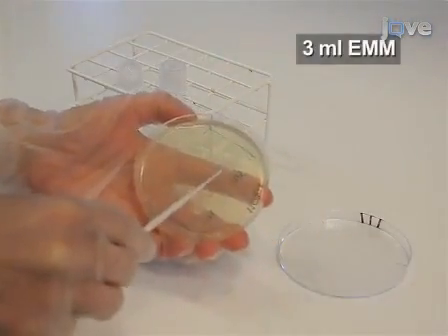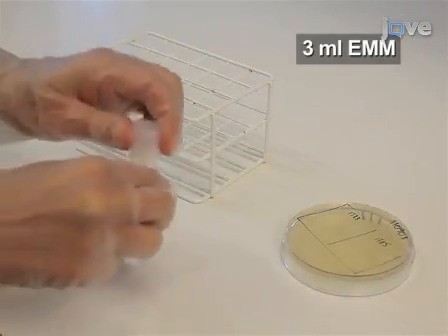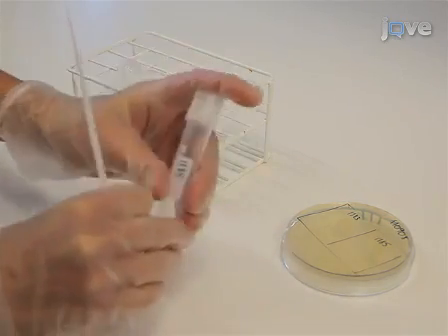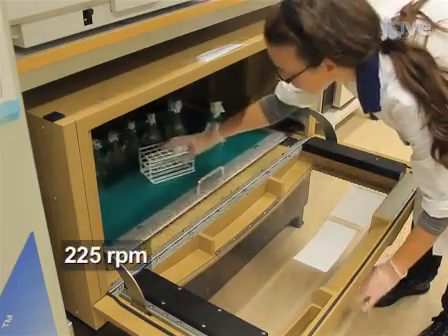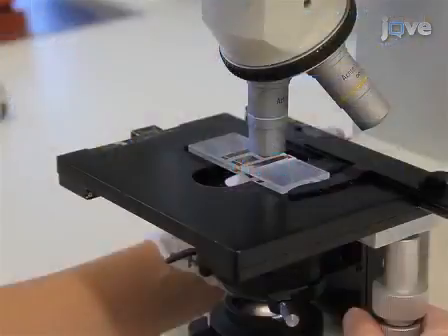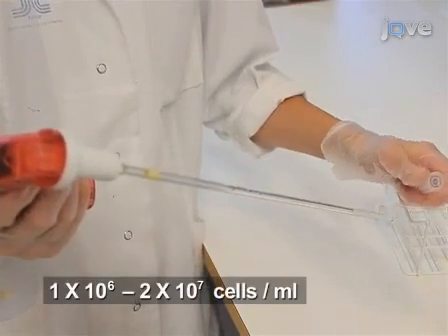Inoculate 3 ml of EMM in 30 ml tubes with fission yeast cells freshly grown on an agar plate in the rich medium YEA. Lightly cap the tubes and incubate the cells in a shaker at 225 rpm and 30 degrees Celsius. Keep the cells in log phase for 2 days by counting them with a Burker chamber every morning and evening and diluting them to the appropriate density.